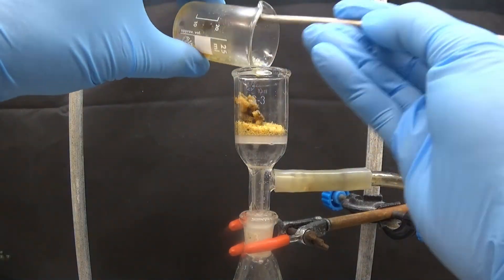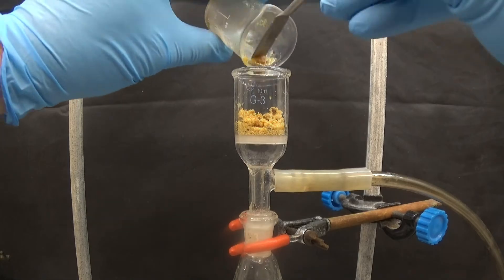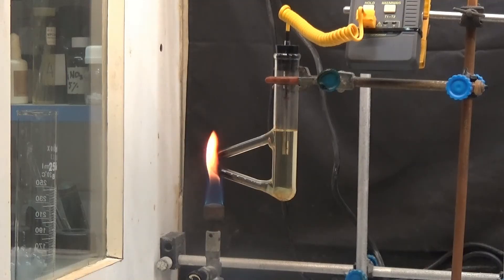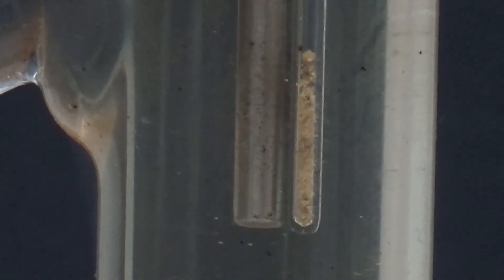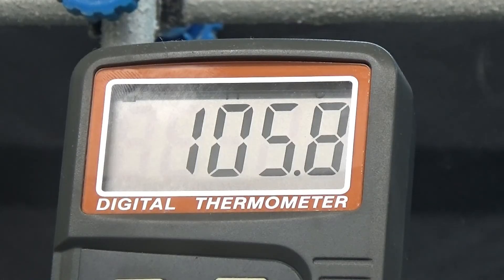Collect by suction and dry at 50 degrees in an oven. In the second melting point test it gave a value of 105 degrees, much closer to the melting point of pure catechol.